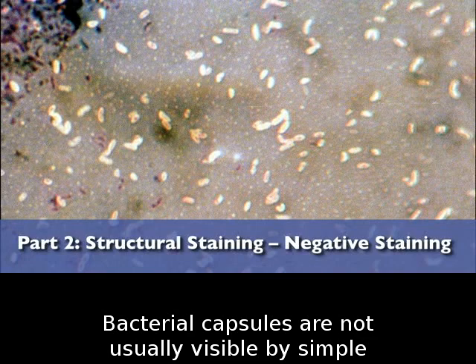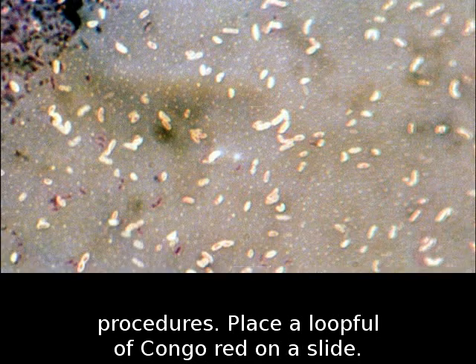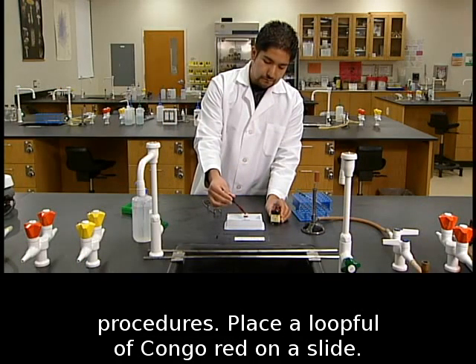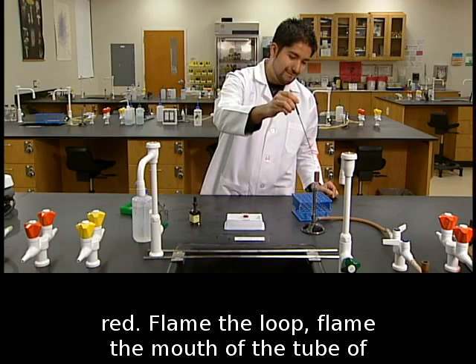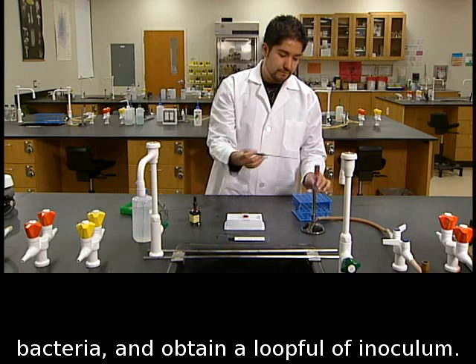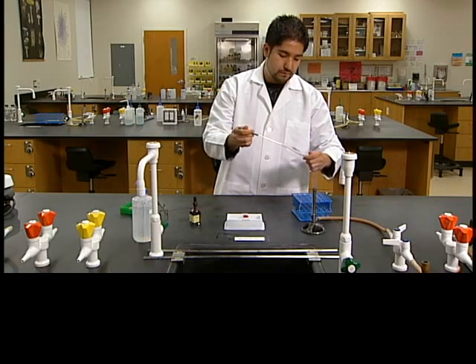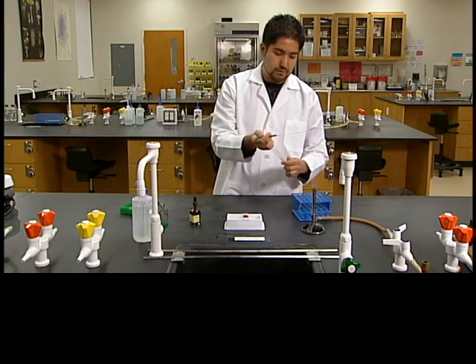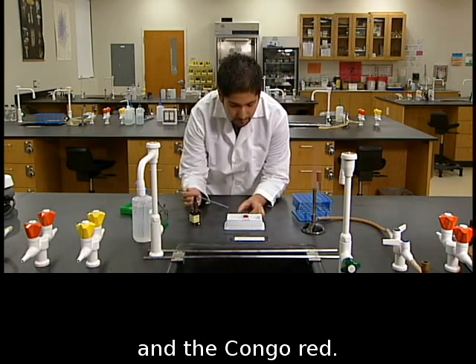Bacterial capsules are not usually visible by simple staining, but can be seen using negative staining procedures. Place a loopful of Congo red on a slide. Make a thick smear of the test bacterium in the Congo red. Flame the loop, flame the mouth of the tube of bacteria, and obtain a loopful of inoculum. Make an emulsion on the slide with the bacteria and the Congo red.